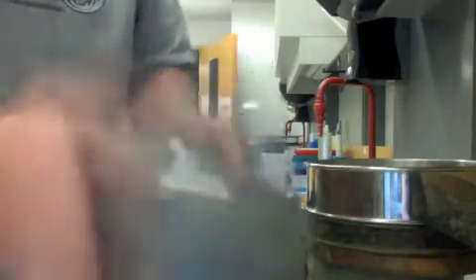Put this on top here, and just shake the heck out of it, and swirl it around a little bit. And again, you should end up with, when you take this apart, sample at the bottom for your hopefully 20 grams of soil.